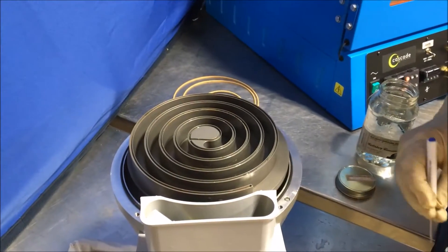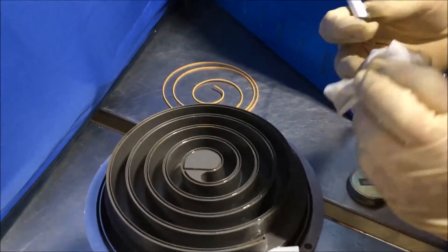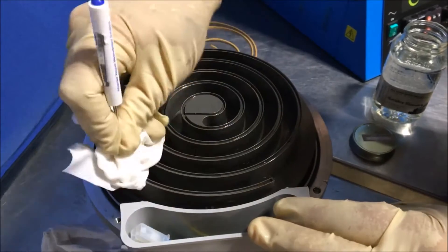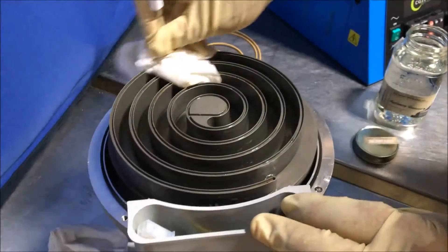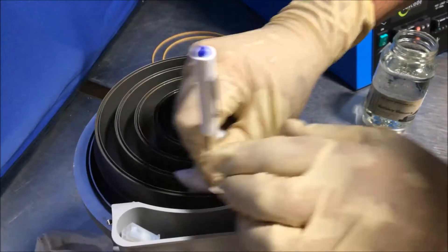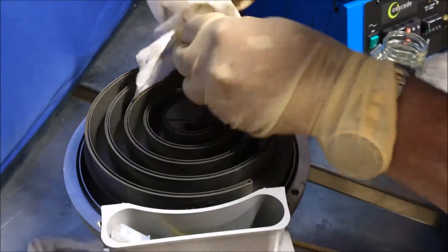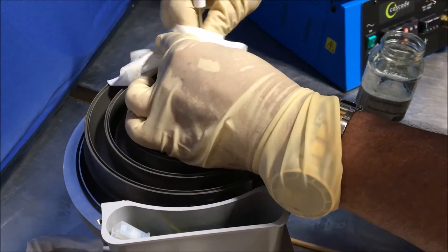Using a very small wooden dowel or a small screwdriver covered by the lint-free cloth, run the cloth through the tip seal groove itself to clean any debris out that would prevent the seal from seating correctly. Take care to make sure you do not contact the screwdriver metal-to-metal with the pump.